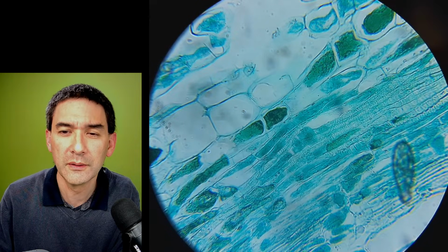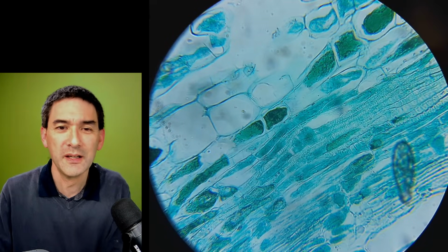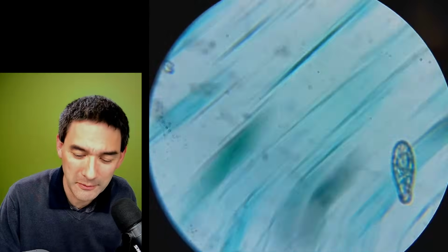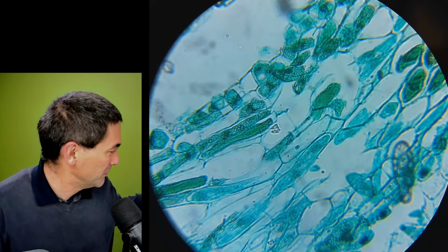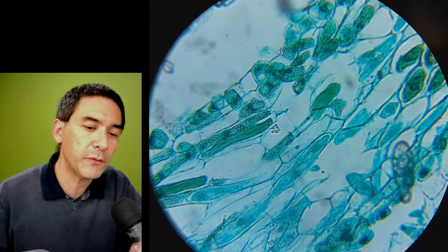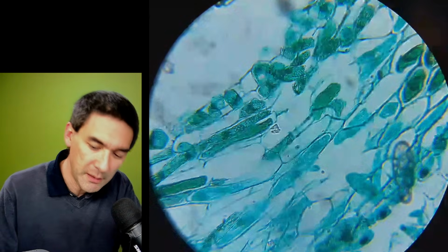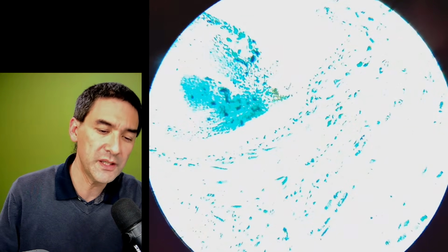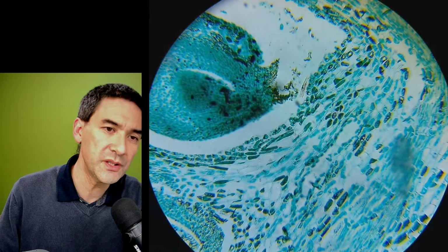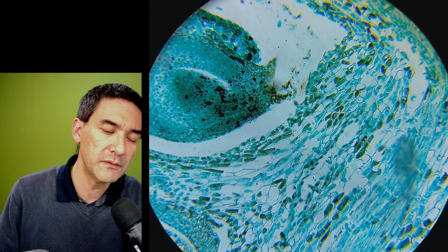I'm just reading this here. Yeah, it looks like a paramecium what we've got there, but it's not. It seems to be some kind of, I don't know, a little bit of some dirt here. So what I would like to do is, I'm going to just switch back to the 10 times. See, it's overexposed, so I have to go again, adjust the exposure here, and then fix it again.